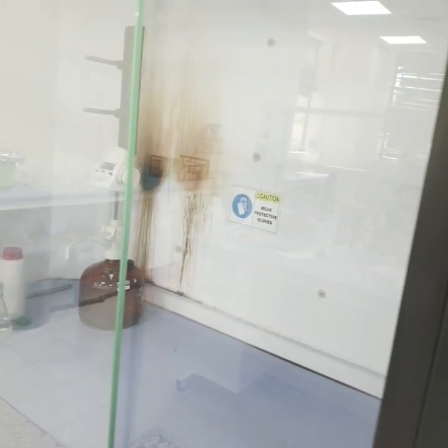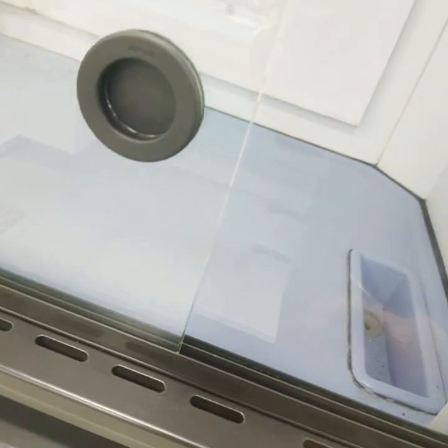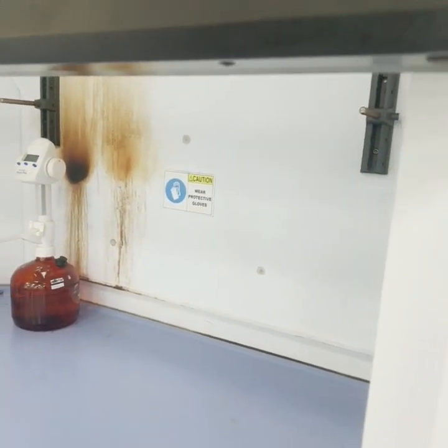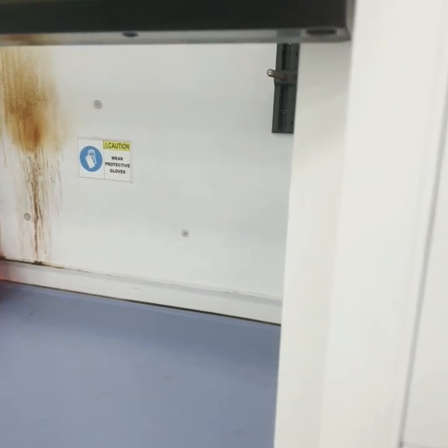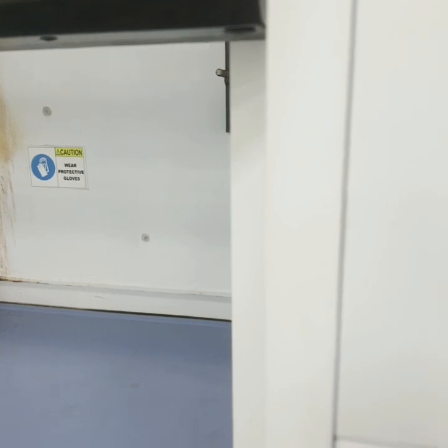Airflow is also measured in CFM. The air volume passing through a fume hood is generally equal to the area of the sash opening multiplied by the face velocity. For example, the sash height should be 18 inches. If 100 feet per minute is required and the sash opening is 7.5 square feet, then the hood's air volume equals 750 CFM — that is 7.5 square feet times 100 fpm.